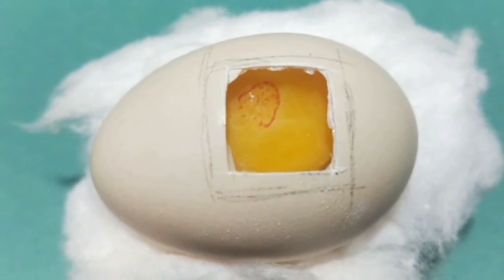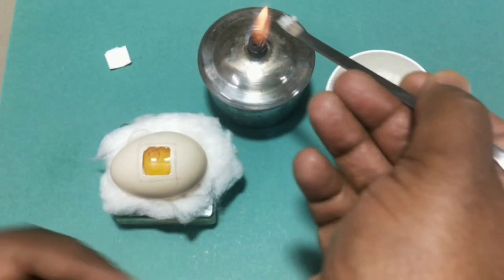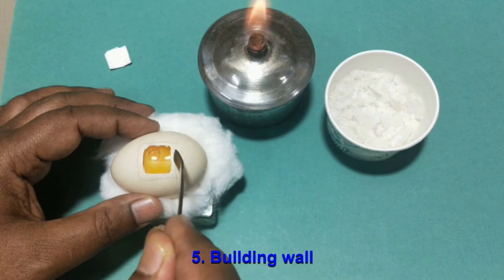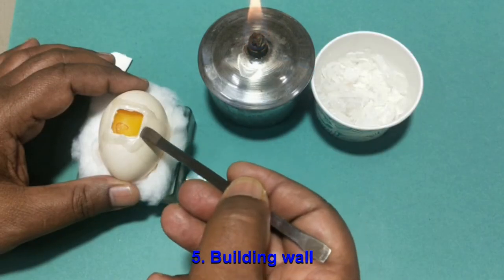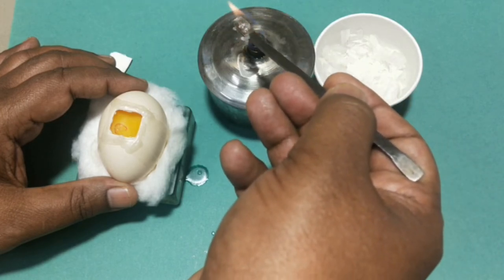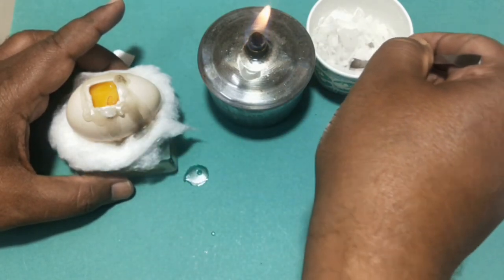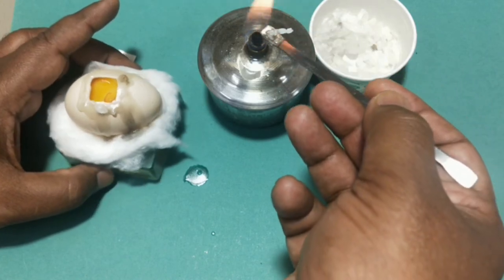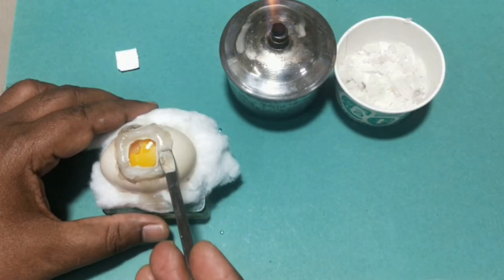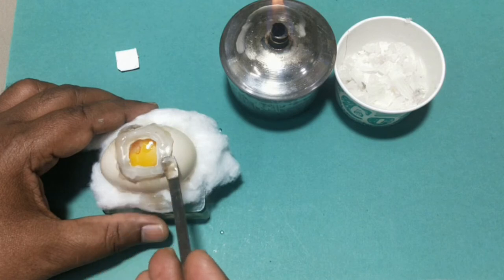This is the embryo of 48 hours old. Take a piece of wax on a spatula and melt it with a spirit lamp. Build the wall or platform of wax of 3–5mm height around the opening. Level the top of the wall and remove the shell membrane using forceps. Here, the membrane got cut.